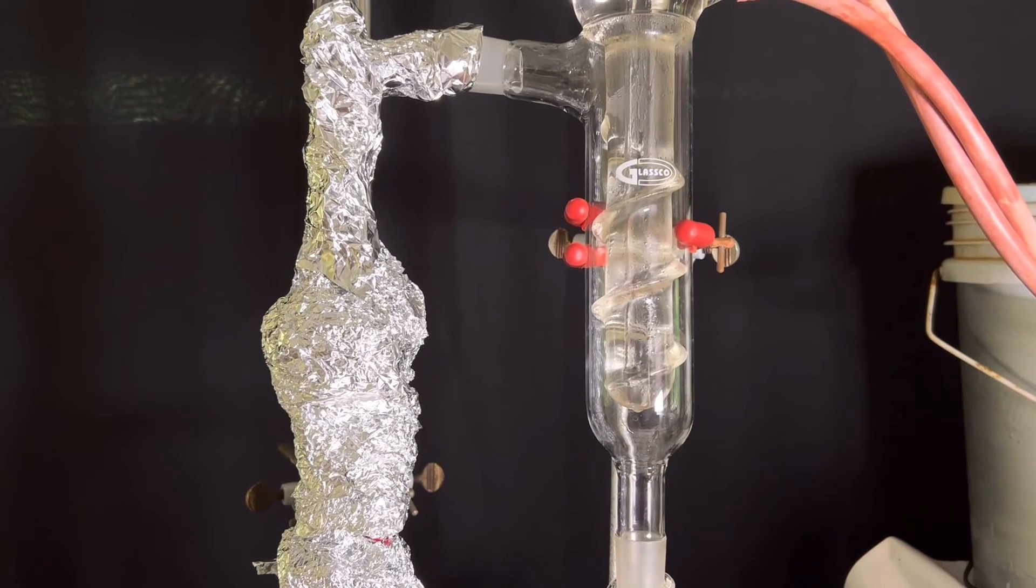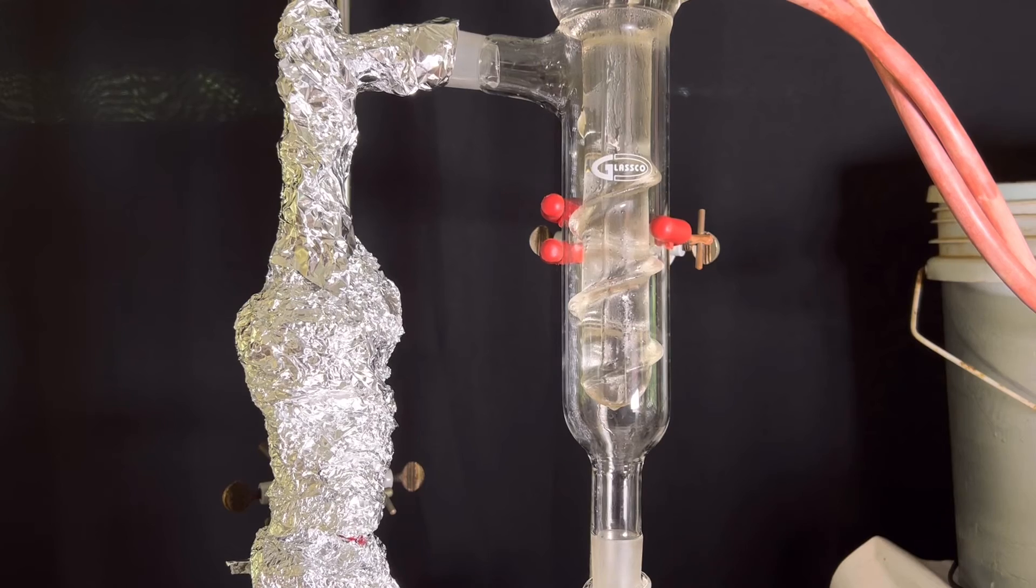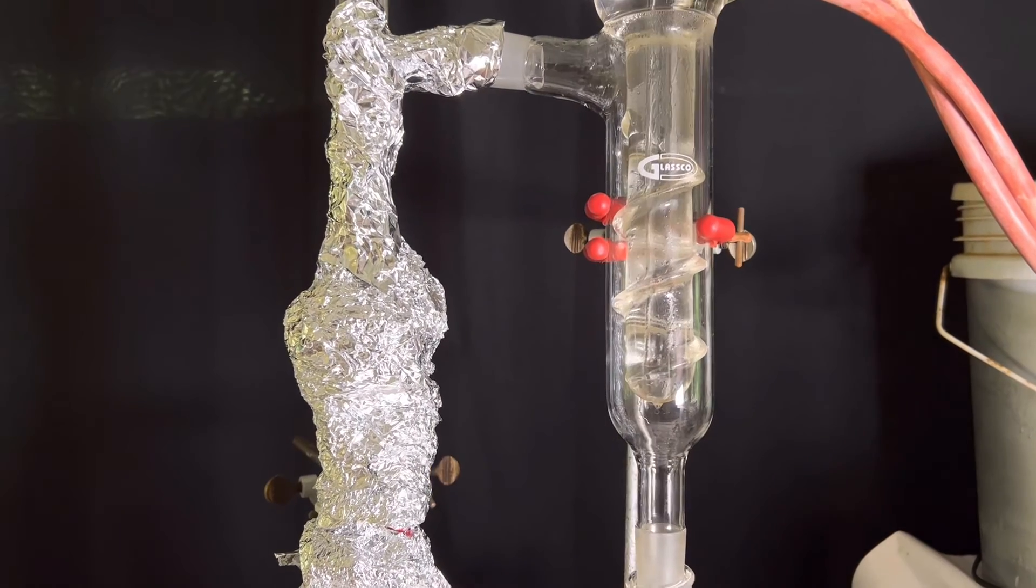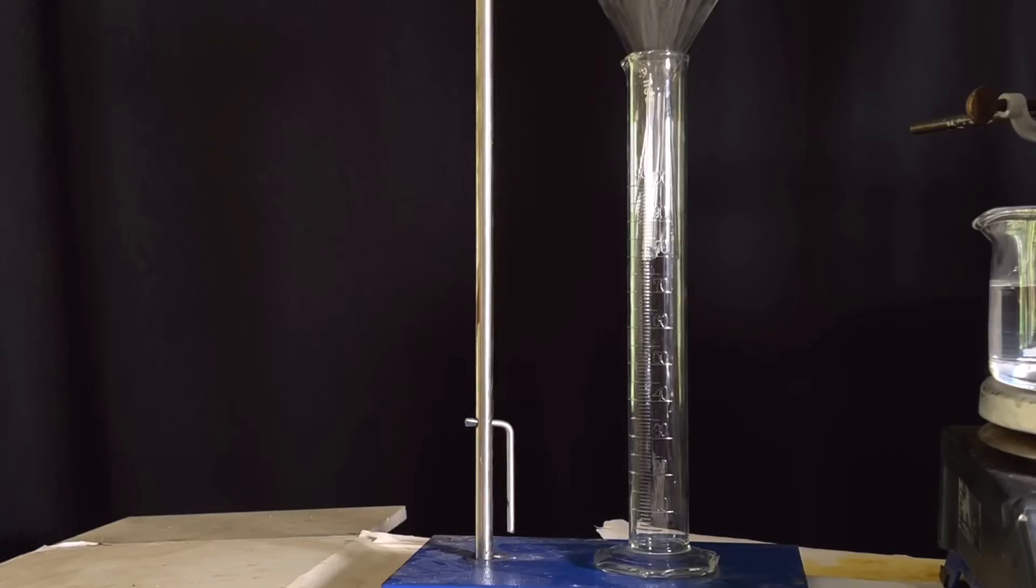After a few minutes, distillation dies down and the temperature climbs to around 50 degrees C. This is when the distillation is set to be complete and the apparatus was dismantled.